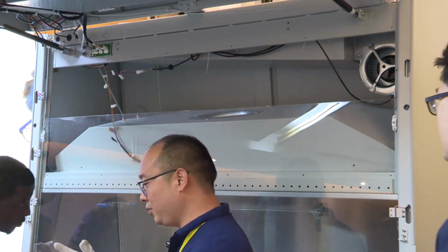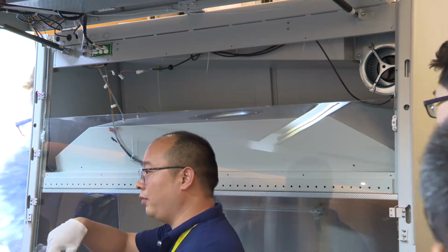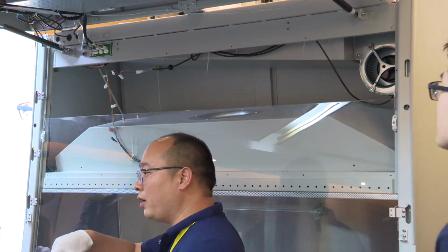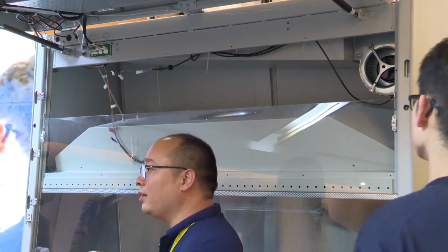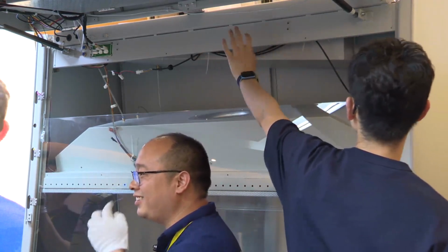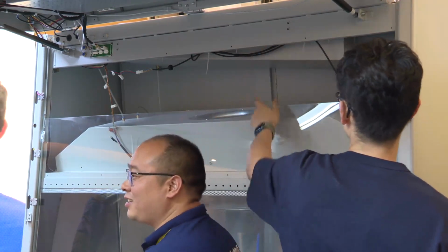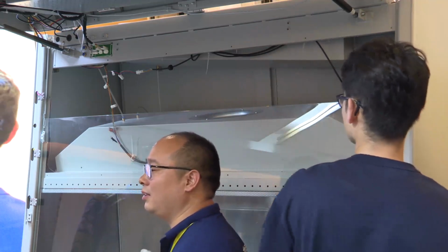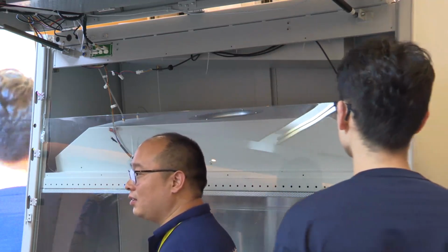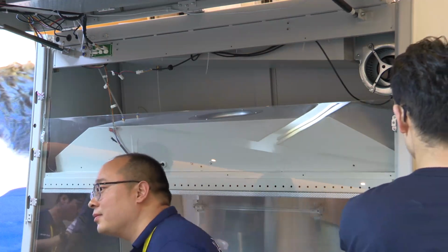We have a generator to fill formalin. Do you provide it when you give the filter, or should we pay for it? It's another product, not included with this.